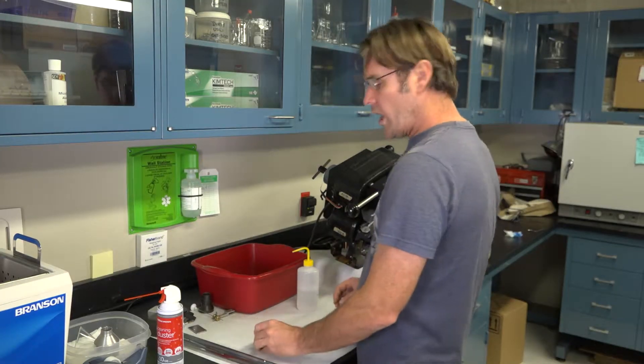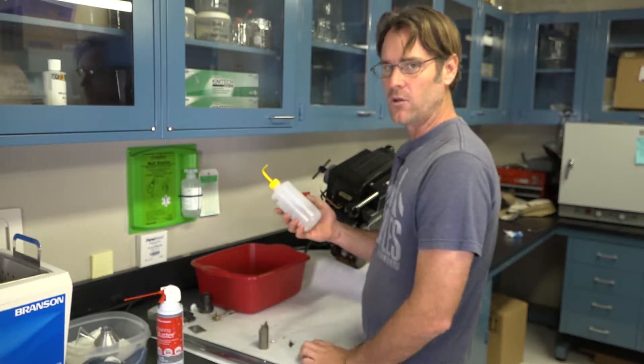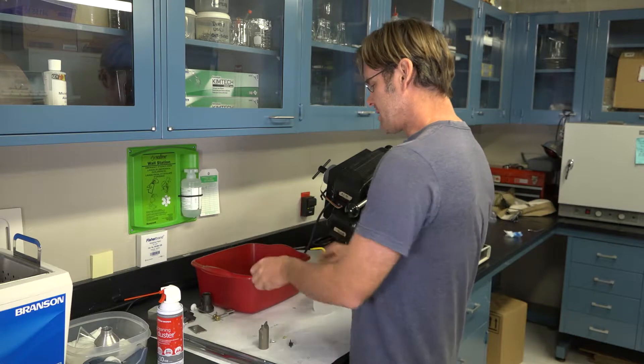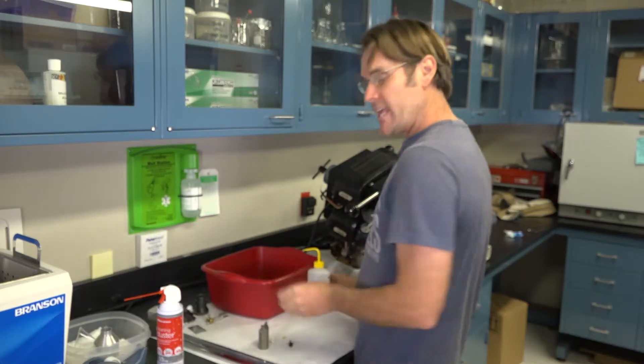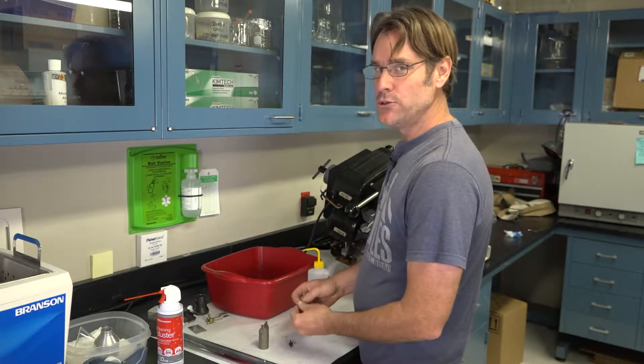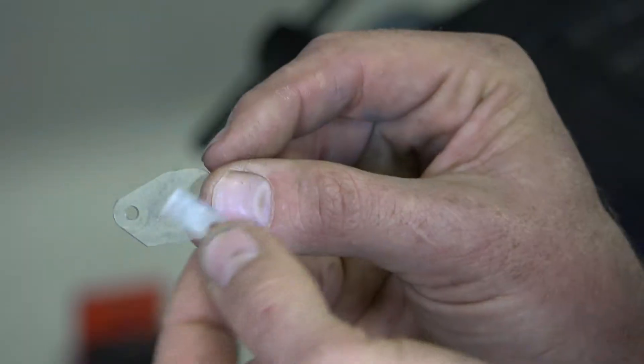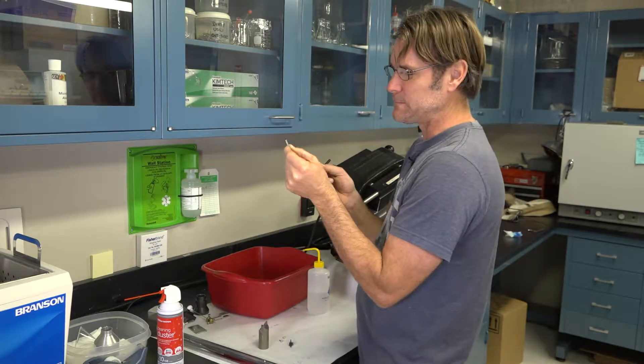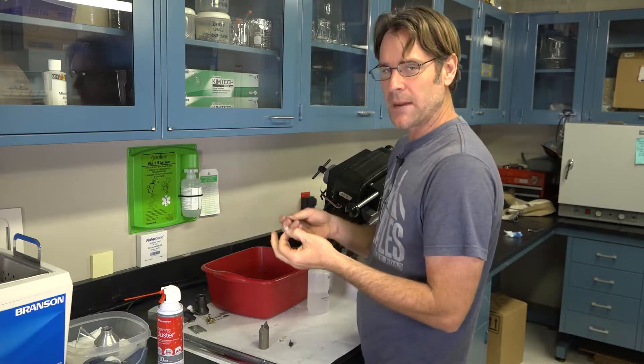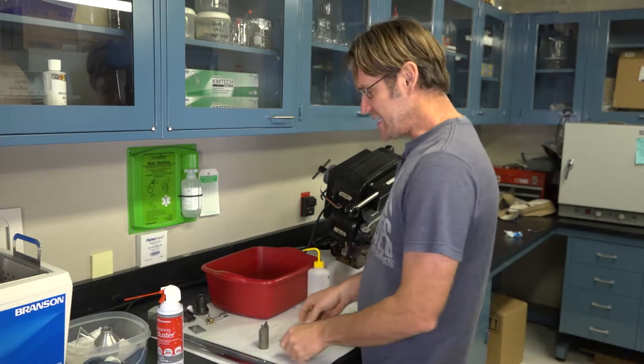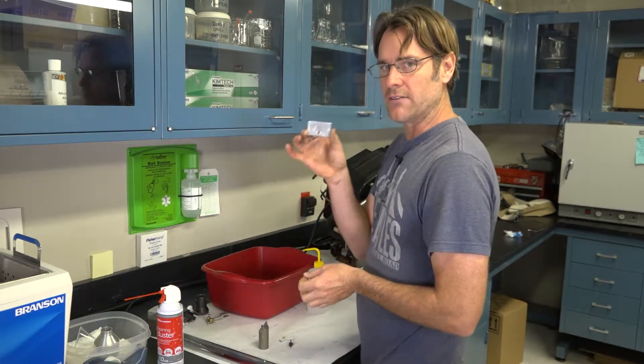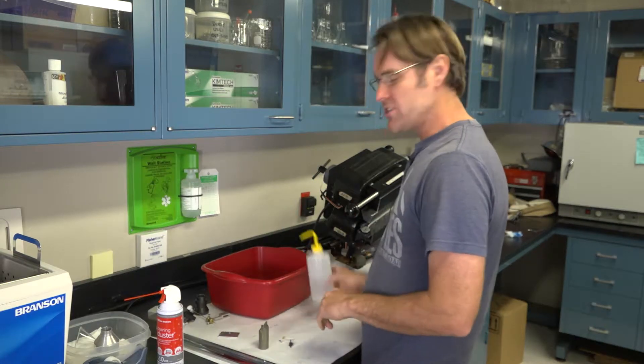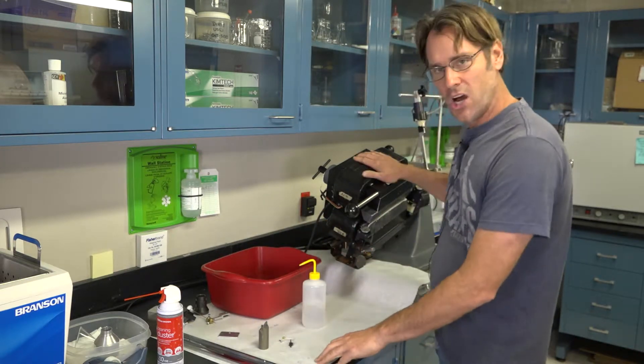You can use two things to wash this with a liquid. You can either use an alcohol, which is pretty thick, like a syrup. Or you can use acetone. But if you're going to use acetone, you have to do it in a fume hood. Since I'm out here, I'm going to use alcohol in our little bucket. If you use acetone, make sure that you do not spray the plastic parts with acetone. Those are the little shields around the sample feeder. You can tell that somebody has sprayed this little bugger with acetone. What happens is it clouds it and it makes it brittle. You spray it a couple times with acetone, it breaks, you're done. And that's why we made the top of the split chute out of aluminum because you can spray this all day with acetone, not a problem. But to be safe, I'm going to just use alcohol on all these parts and on the entire Frantz itself.